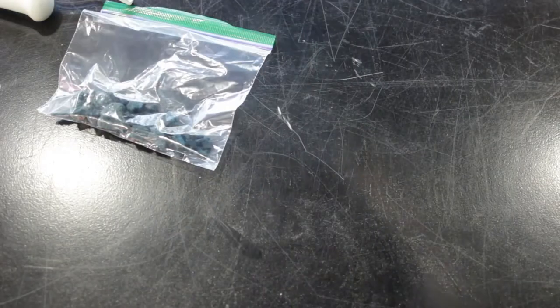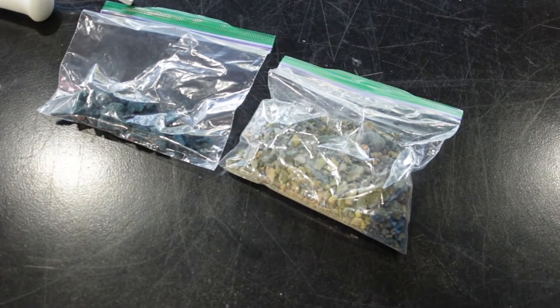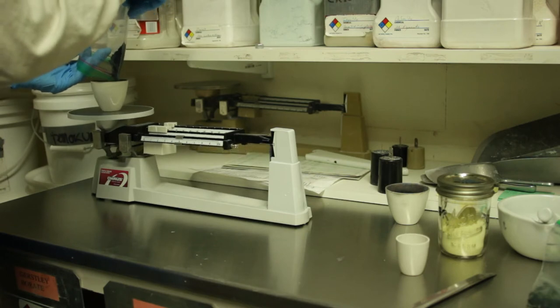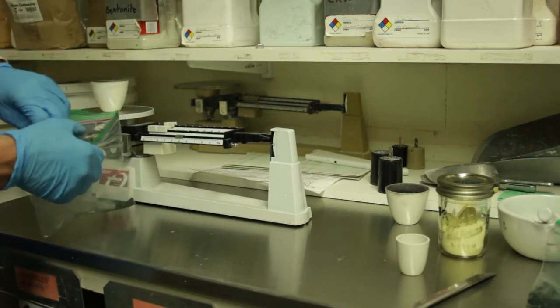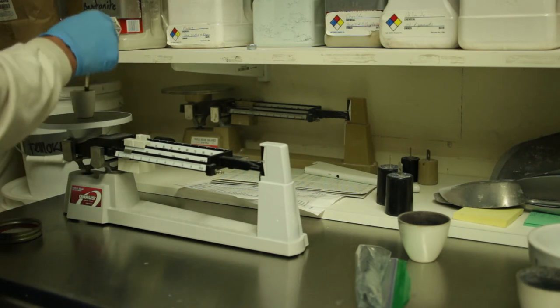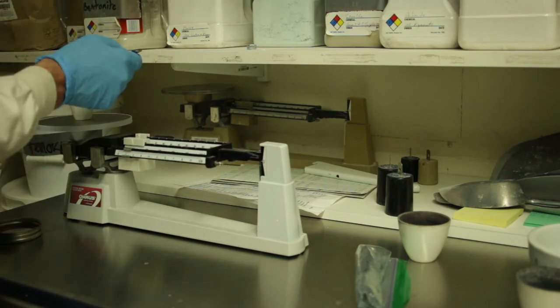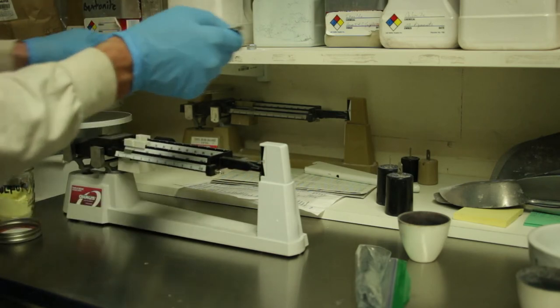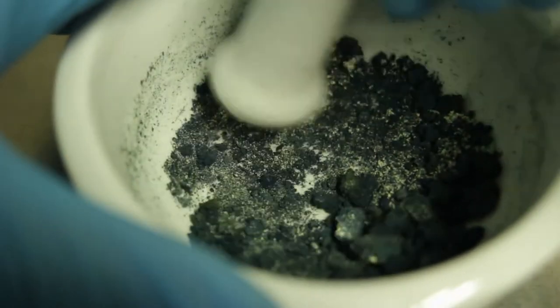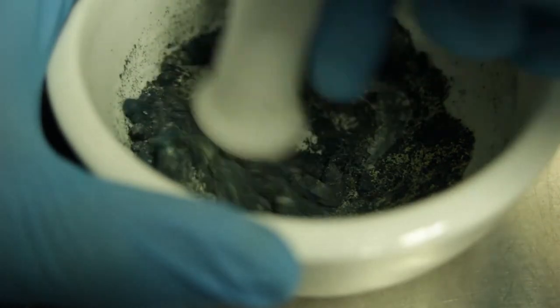Here's the green stuff — it looks blue in this shot but it's green — and there's the yellow and brown material as well. The next day I would fire up the furnace to 500°C and weigh out however much green material I wanted to oxidize, adding 10% by weight of sulfur — approximately the size of the charge that would be added in Hammerton's procedure. In this step the sulfur acts as an oxidizing agent, taking the polysulfides inside the aluminosilicate cage and oxidizing them to the trisulfur anion.